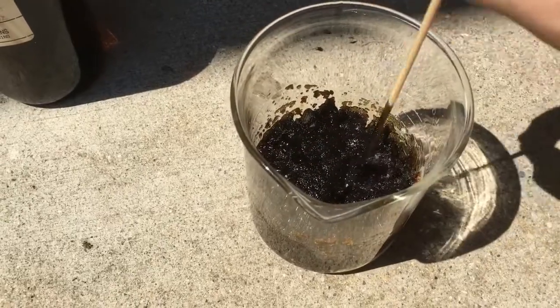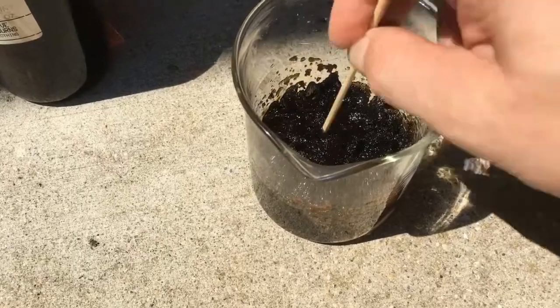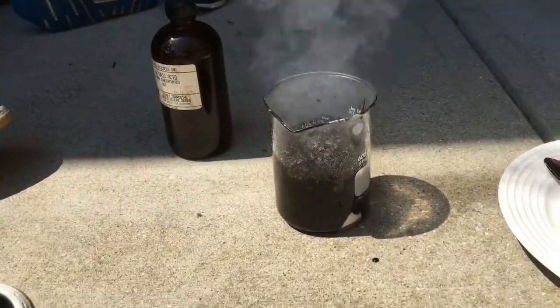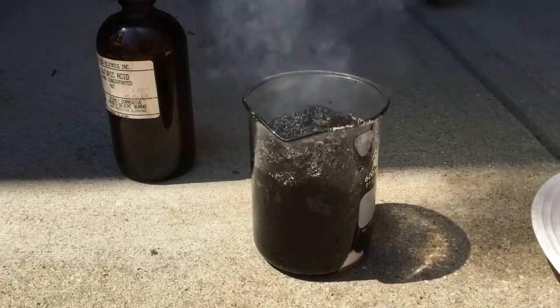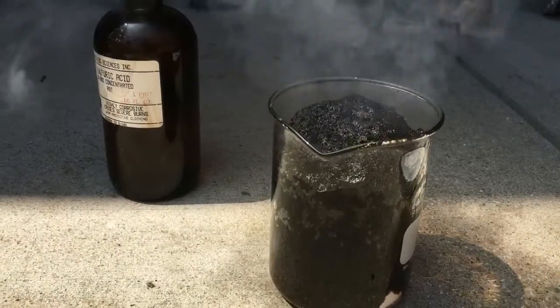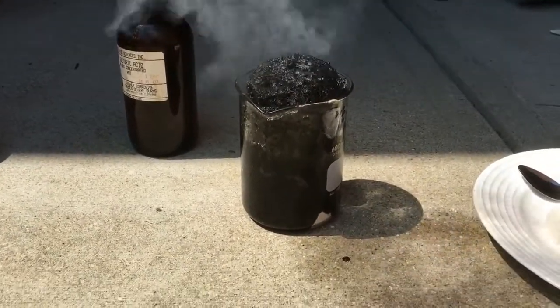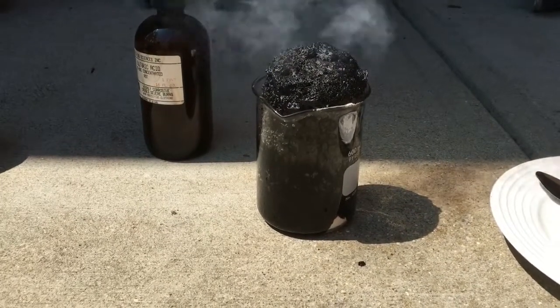It's going to go from chemical potential energy to chemical kinetic energy. And once it starts moving, it's going to release a lot of heat. Some of that heat is going to be released, and let's look at what happens. What happens to that carbon? Is it moving? Yes. Starting to move. Let's keep watching. Oh, this actually smells like raisin. Let's see how much it moves. Now we know that we are mostly carbon-based life forms, aren't we? So most of our bodies are made of carbon.